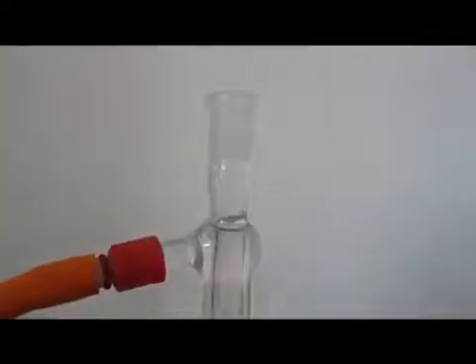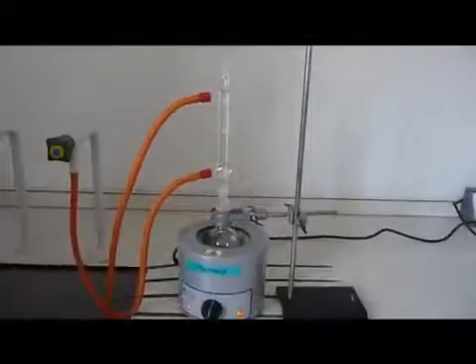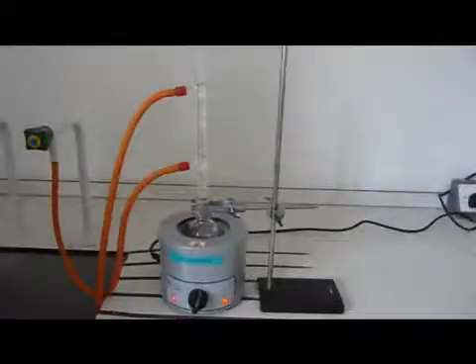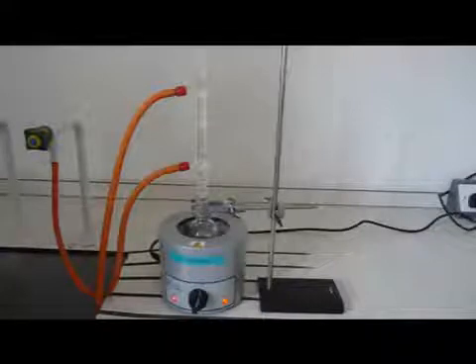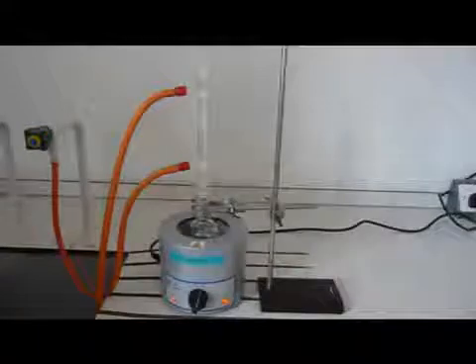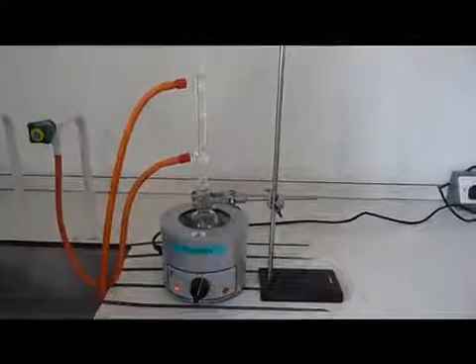Remember that there should be no fumes or vapor coming out of the condenser. Avoid sitting directly in front of the apparatus if possible to avoid any violent bumping or spills. Monitor the process to ensure all is safe.